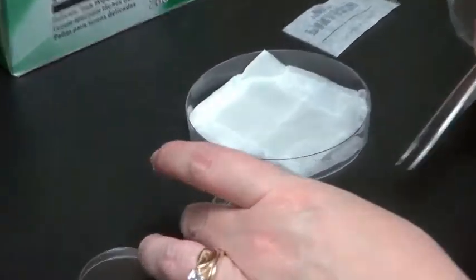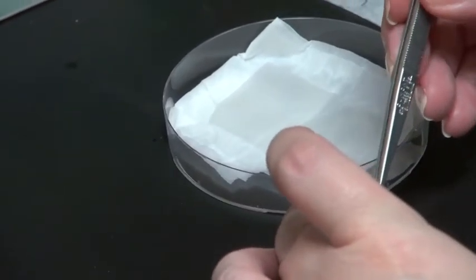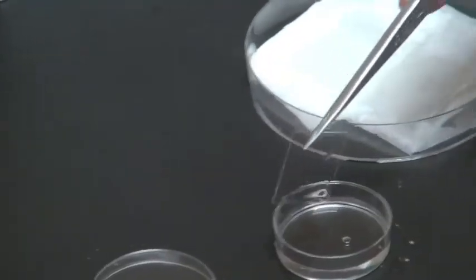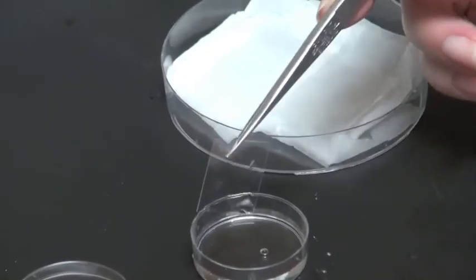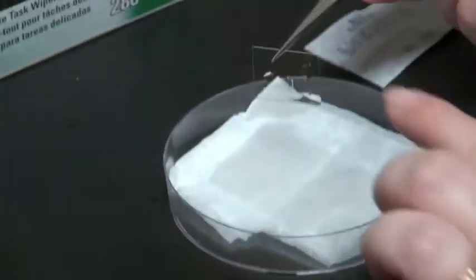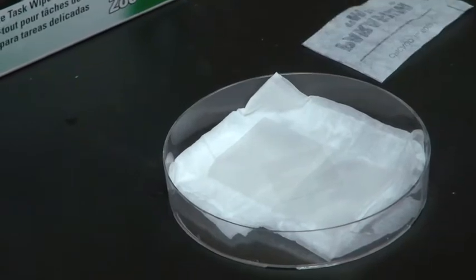I'm going to do it upright, so I'm going to take my cover glass with my needle-nose tweezers and make sure that I don't have too much excess washing liquid. I'm going to put it cells-up on top of my parafilm.